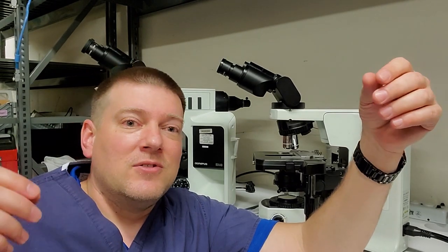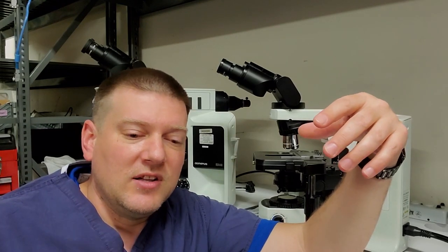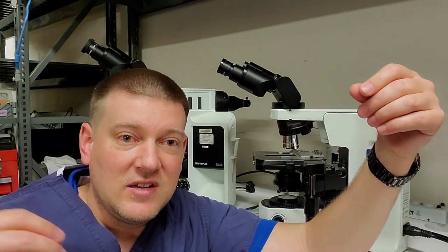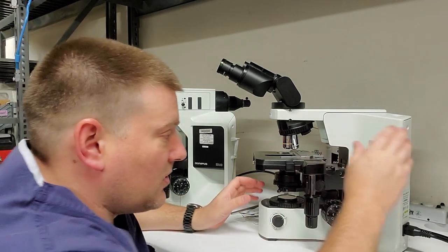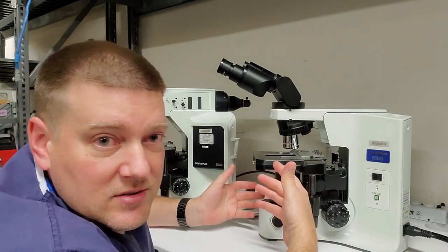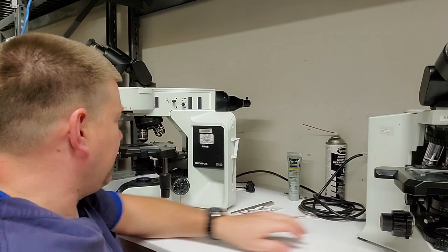which is a very cool way of thinking about it. So the cool thing about dark field microscopes is that you can see really clear and small objects much better than with a light field, especially with like bacteria and like living tissue and stuff. And you don't necessarily need to stain the slide to see the contrast. Just the tissue densities with a dark field show contrast. So the dark field looks almost exactly like a light field, except there's going to be a disc someplace. Okay, so that's the bright field and the dark field.